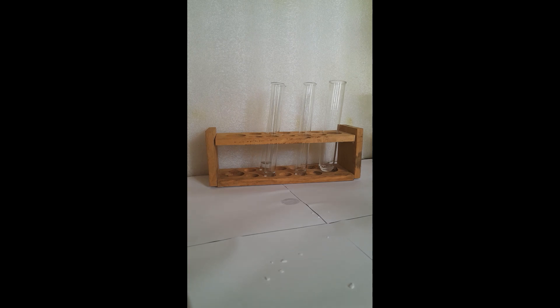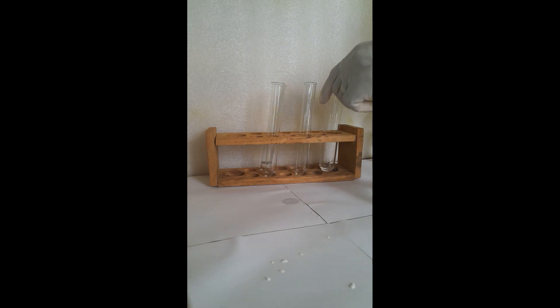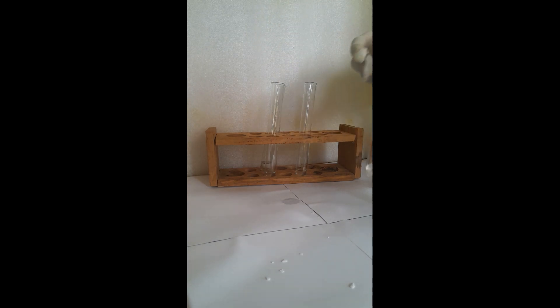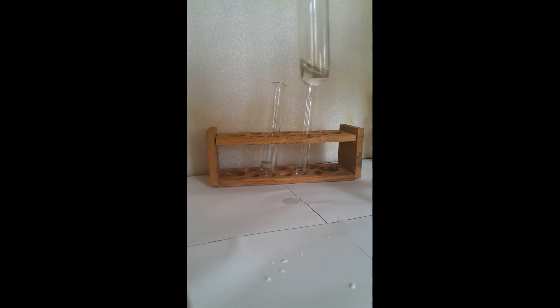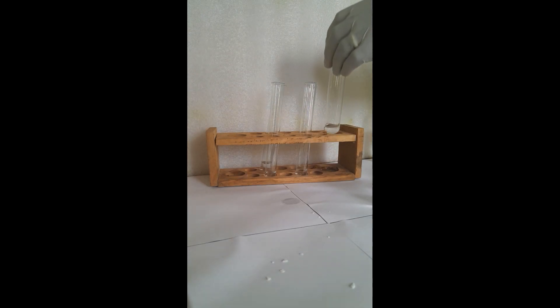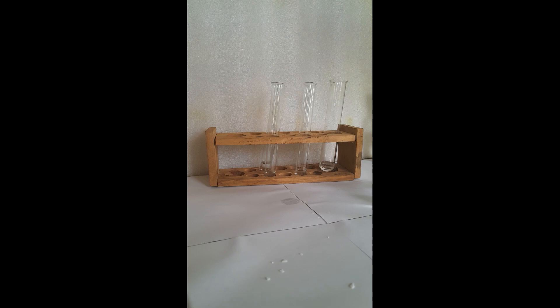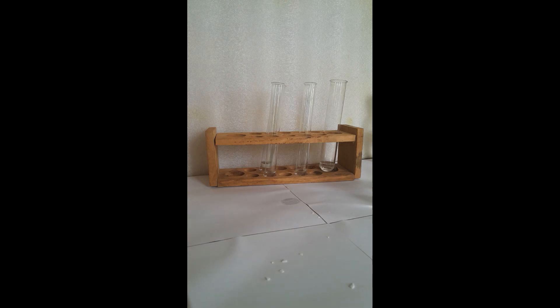If we first test this solution plus sodium hydroxide — this is my sodium hydroxide, I'm adding it now. Of course there will be no reaction. No reaction takes place when you add sodium hydroxide. So under your test, observation, and inference table: the portion plus sodium hydroxide — no precipitate, no reaction.